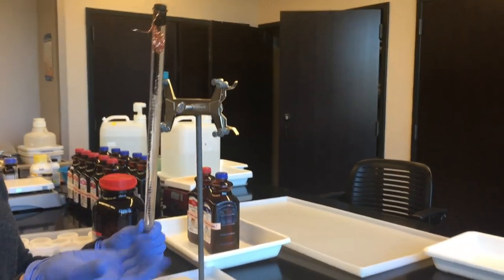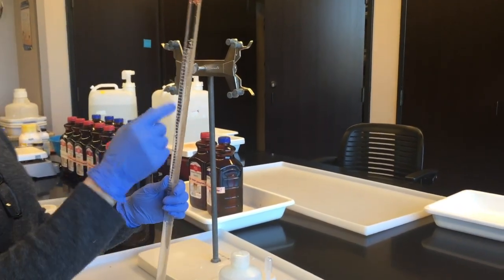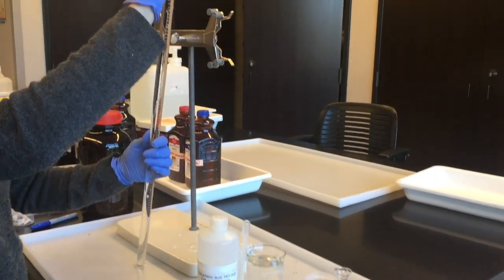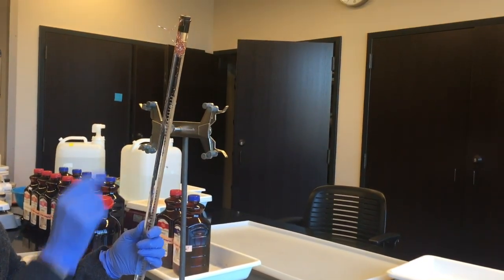A little bit of water came out there but I'm not worried that I'm getting acid on myself because the acid is down here and we did it so carefully that the only thing up here right now is water.